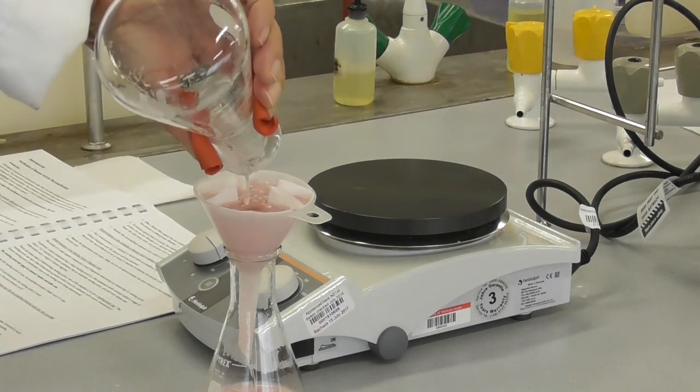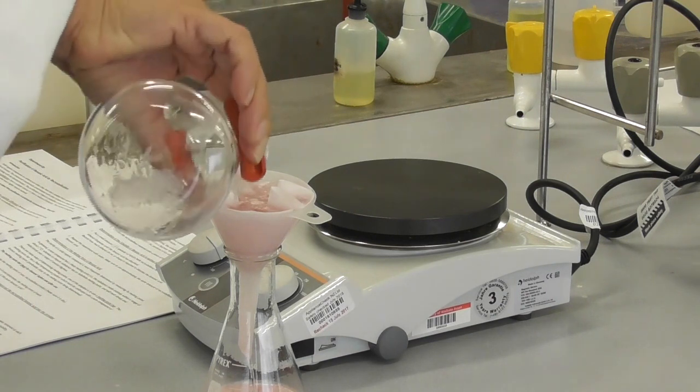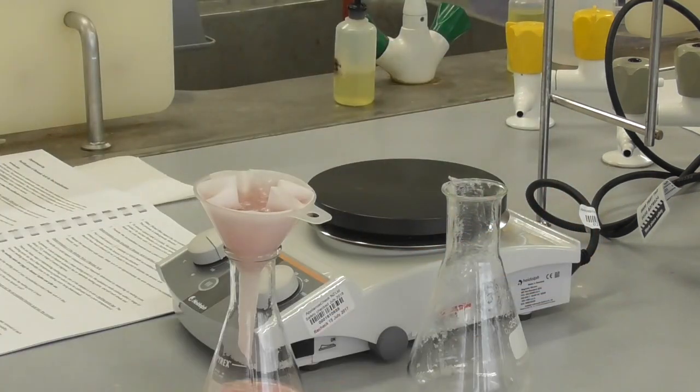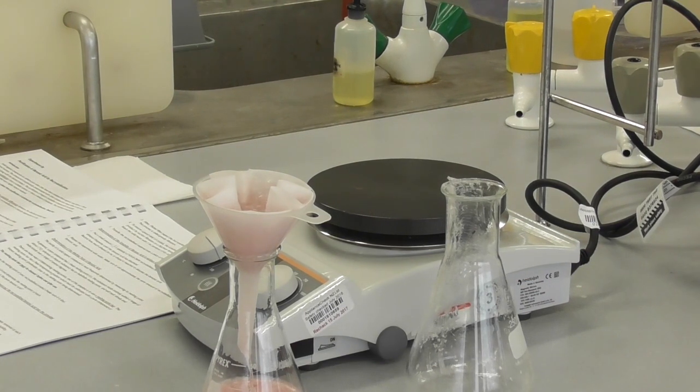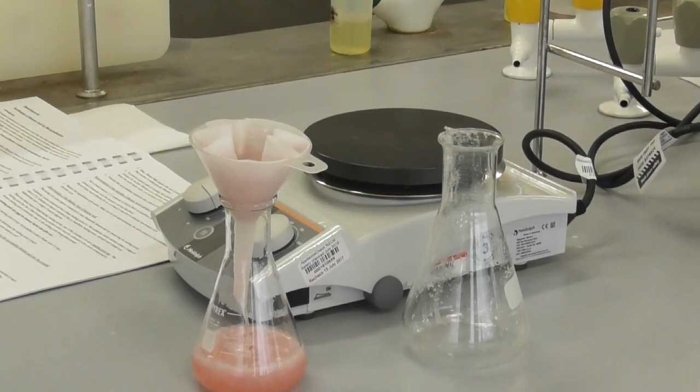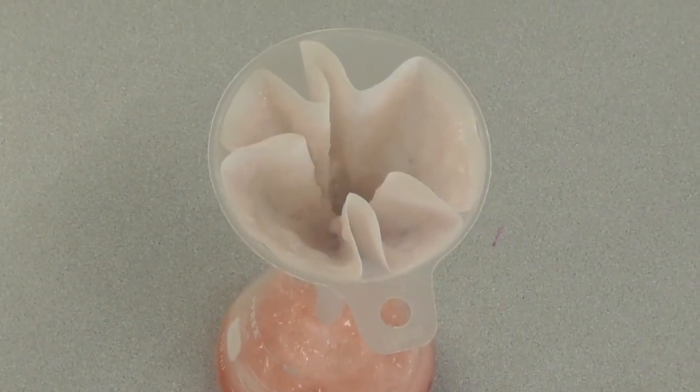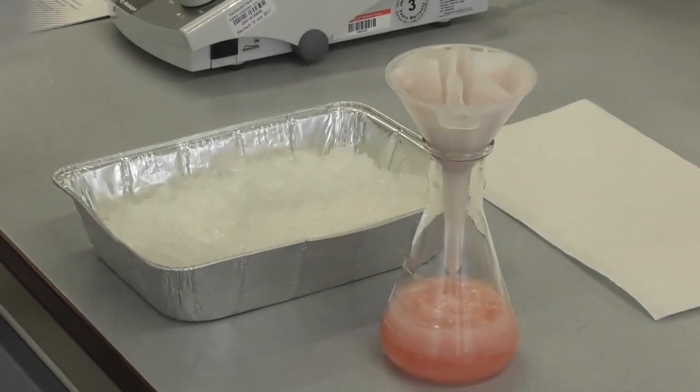While the solution is running through it cools off and starts to recrystallize which might clog the funnel and get stuck in the filter paper as well. Insoluble impurities and some benzoic acid will be left behind in the filter paper.